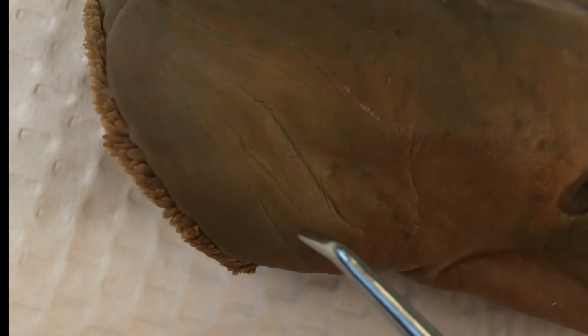Again, using those papillae to orient ourselves, we can go to the top of the animal and see the single nares and the pineal organ. There again is the eye. Again, using those papillae to orient ourselves and looking at the dorsal part of the animal, we can see part of the lateral line, that pineal organ again, and that single nares.